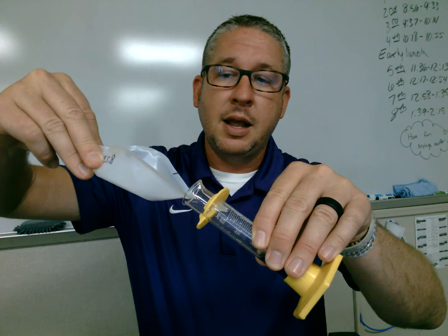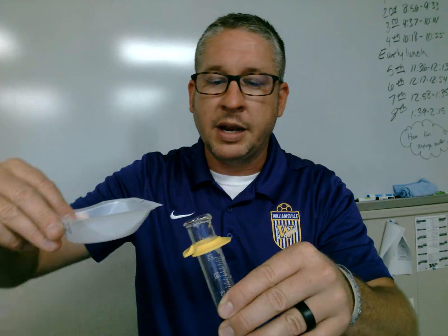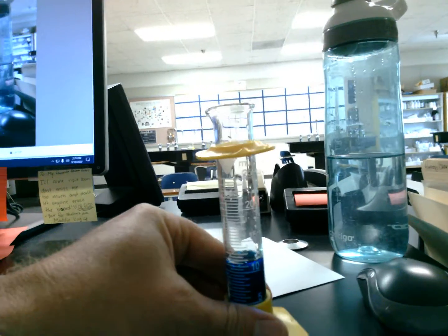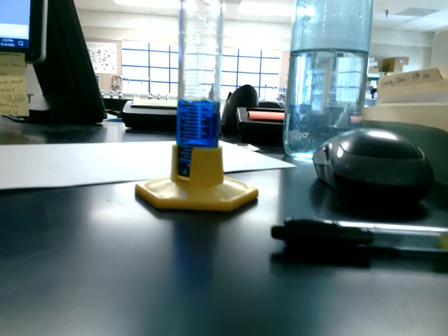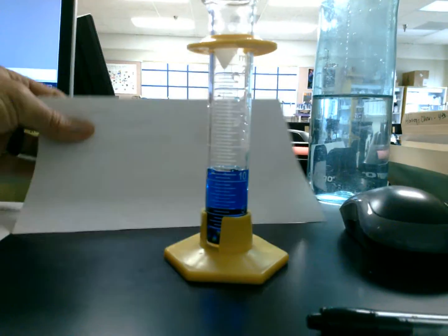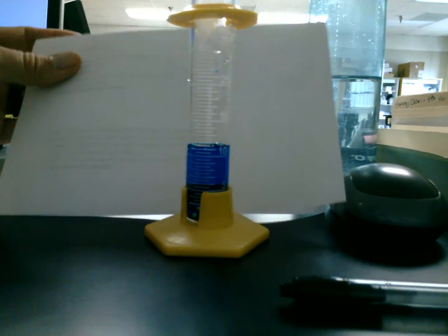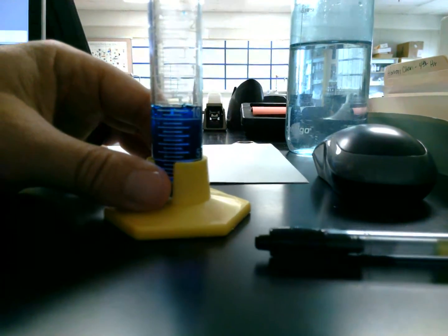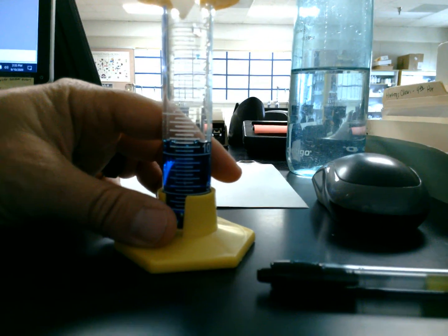So tilt it to the side, squeeze the weighing dish gently, making sure they all get in there, and then I place the graduated cylinder back on a flat surface, and I get eye level with it. I'm going to try to get all the air bubbles out of there, okay? And if you can see that, if I pick this up here, okay? I am reading, I know, I'm sorry, there's really no best way. That kind of looks all right.